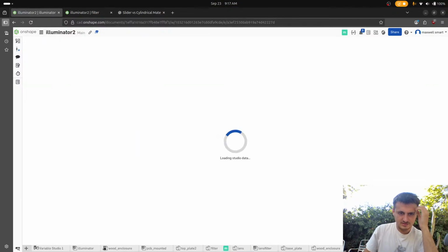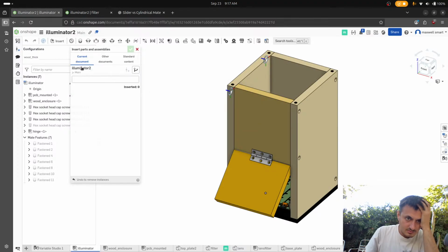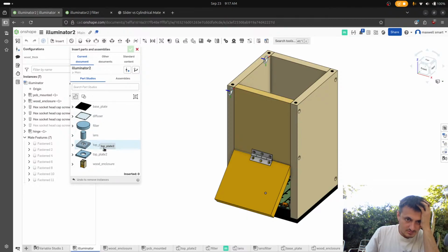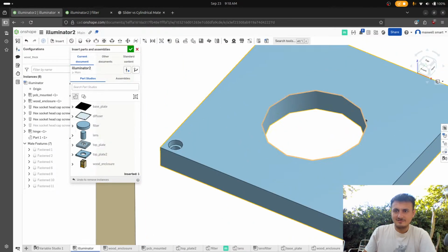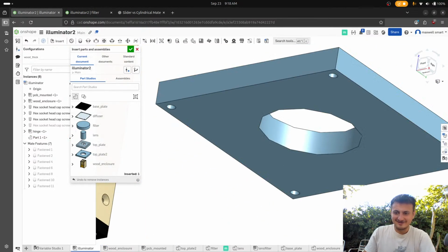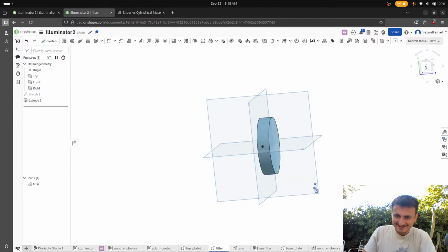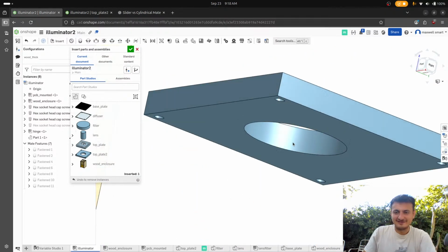Well, okay, let's just mess around a little bit. So if we were to insert top plate. Wait, why is that? What? How is that possible? I feel like it's rendering weird. What is that? How did that even happen? Okay, that was funny.